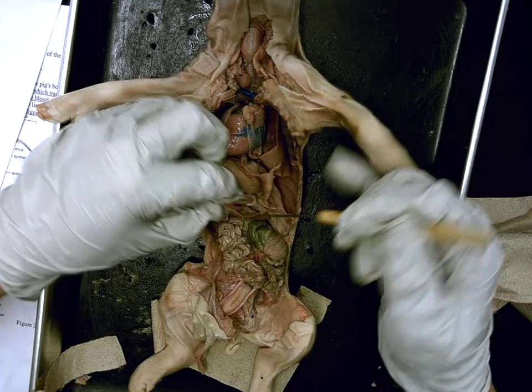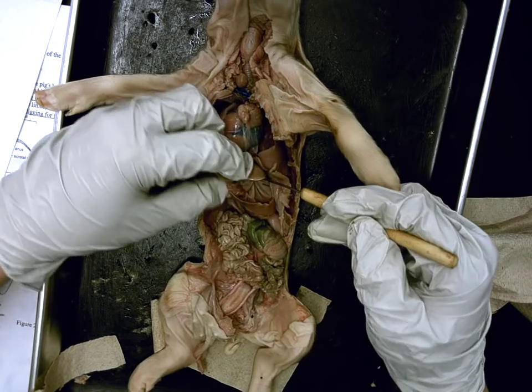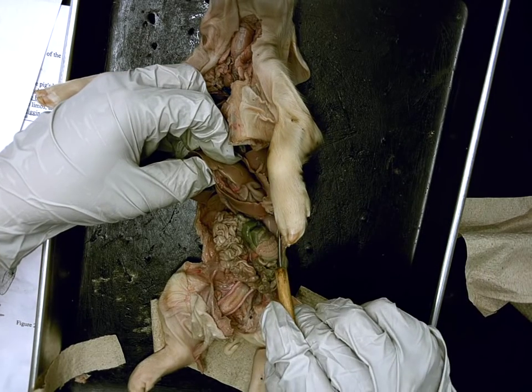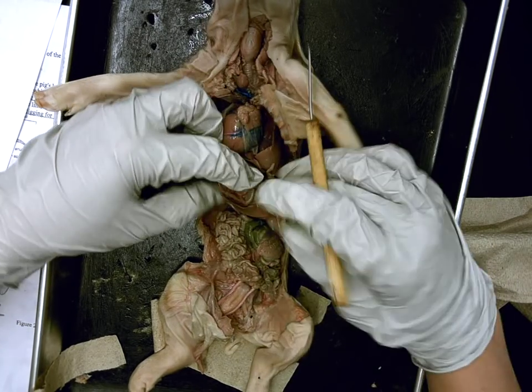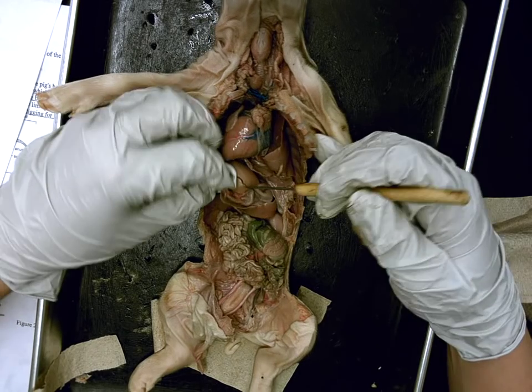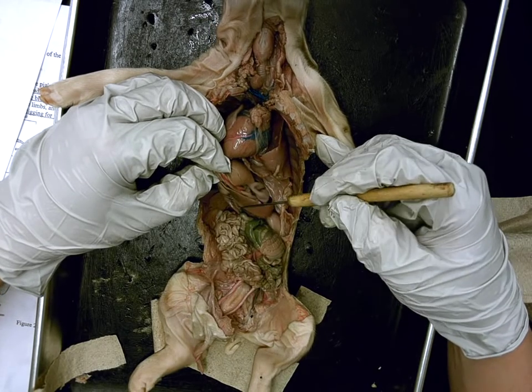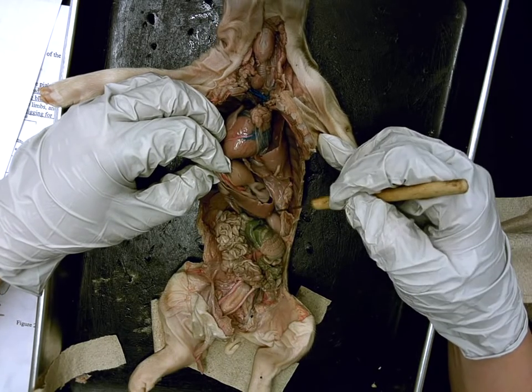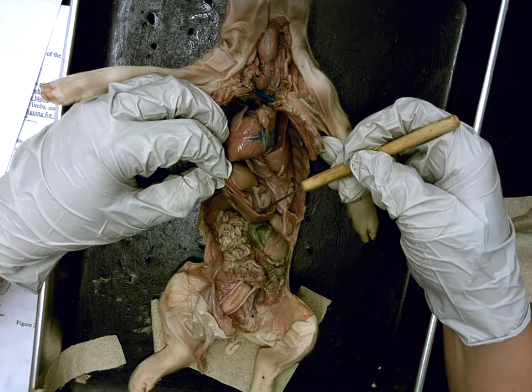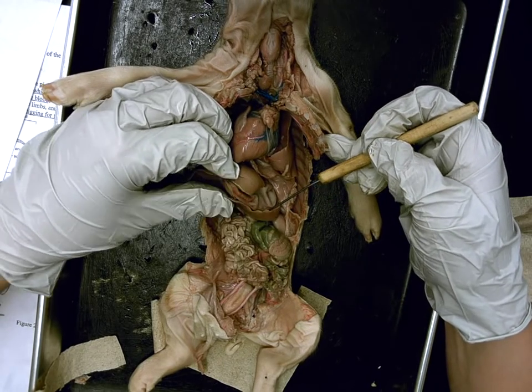Wrapped around the pouch of the stomach is this flat, darker, smooth-looking organ. Henry, what would this one be? Spleen. Three functions of the spleen, Henry? Creates, stores, and removes red blood cells. Beautiful.